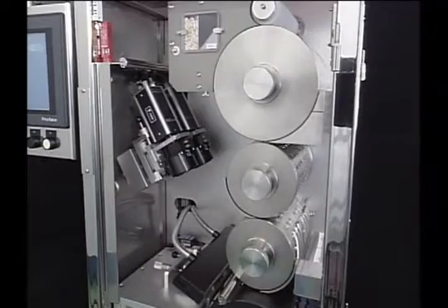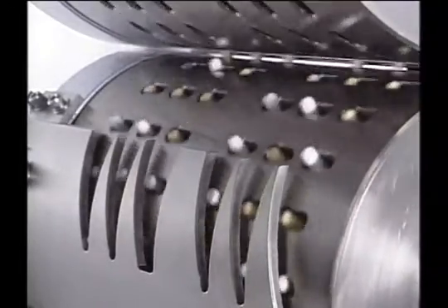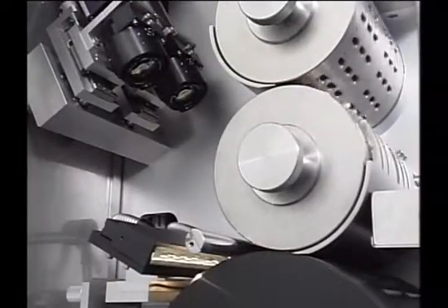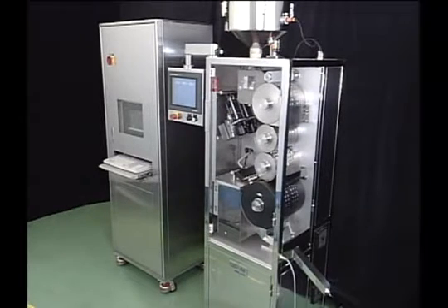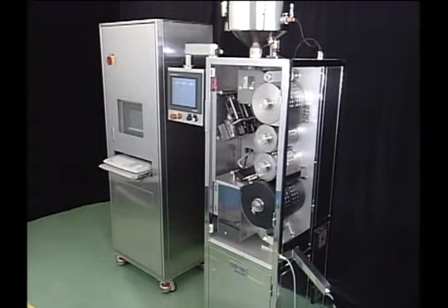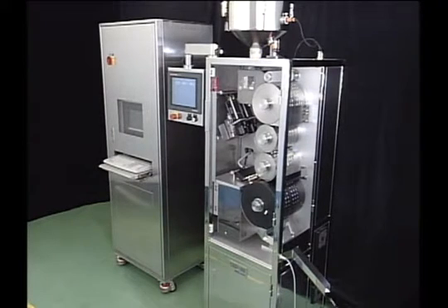It is also possible to connect the capsule inspection machine to the filling machine and weight inspection machine, so all of the machines can operate automatically. The CES-100 is a machine that fulfills the demands for quality as well as cost-effectiveness when producing drug products.